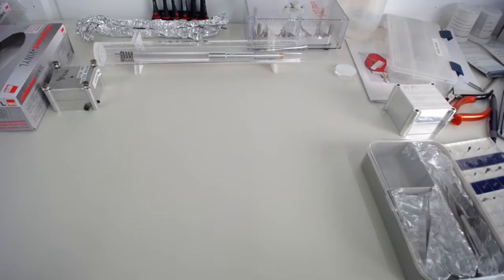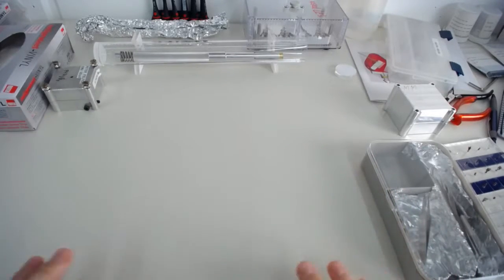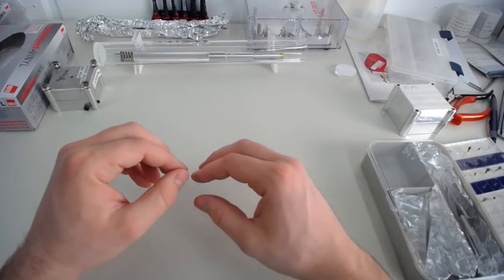The second part of moving it into the atom probe will be a separate tutorial because I need to connect the atom probe's control computer to the screen capture device. So now we're here at the workbench in our atom probe lab. You can see it's a normal table, which is okay, it's not ideal. Ideally you'd ground your work area, so you connect it to electrical earth.